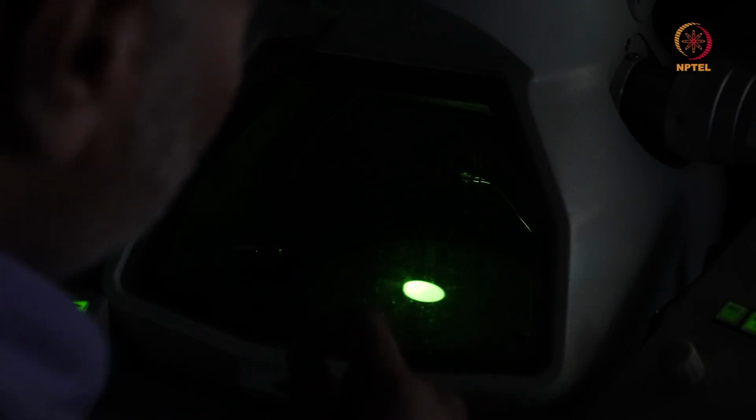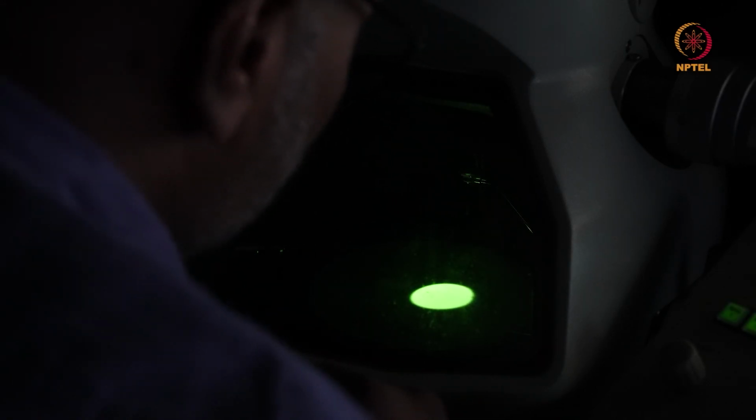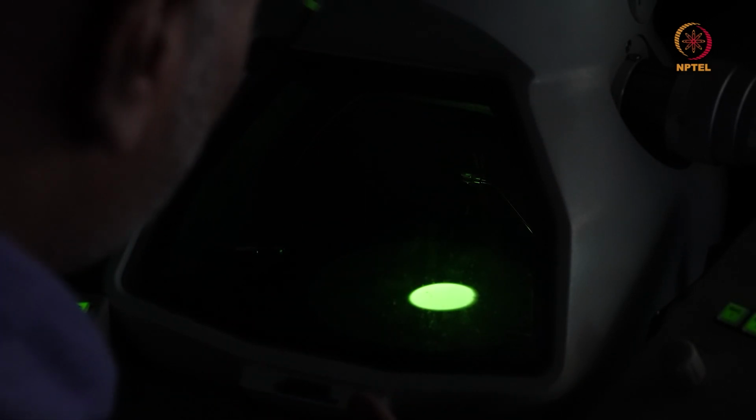How do I know that it is actually properly centered? In a lanthanum hexaboride filament system, I'm not sure if it is visible in the video very clearly, you see a shadow around the edge of the aperture, typically a slightly brighter line. This is more prominent in a FEG TEM system, but in a LaB6 you do not see the shadow very clearly.